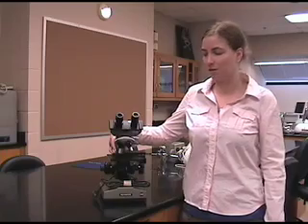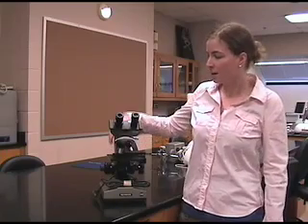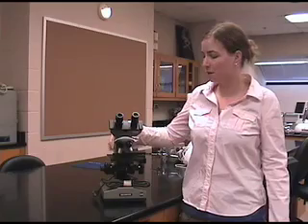Hi, my name is Laura McLean and this is the introductory video for the Biology 141-142 laboratories. Today I'm going to be telling you a little bit about how to use this binocular compound microscope.